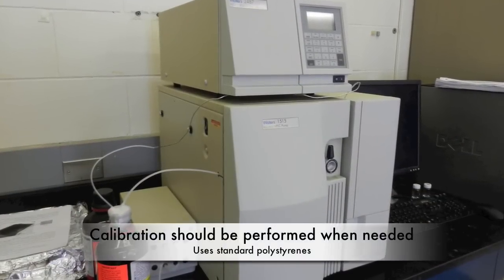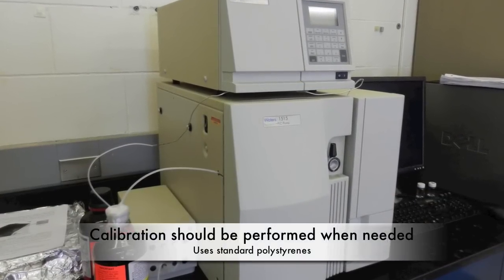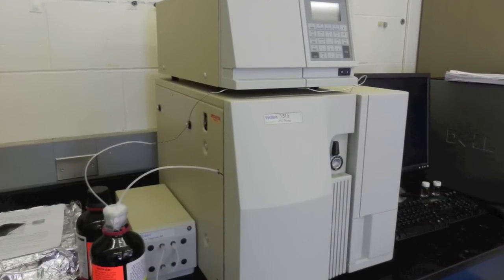Calibration should be performed when needed. This consists of analyzing standard polystyrene with several molecular weights.